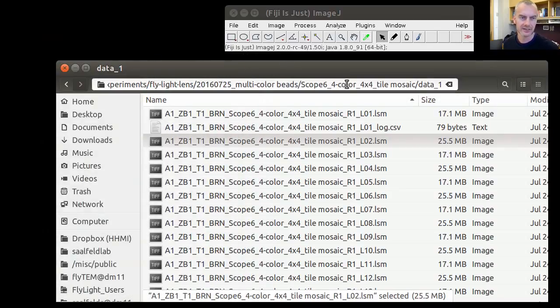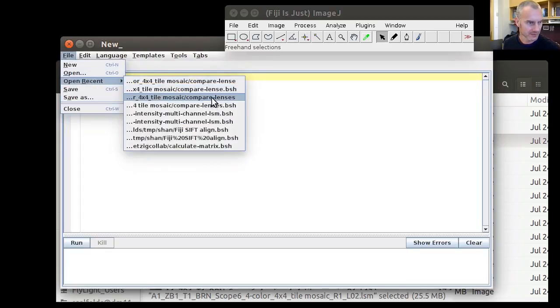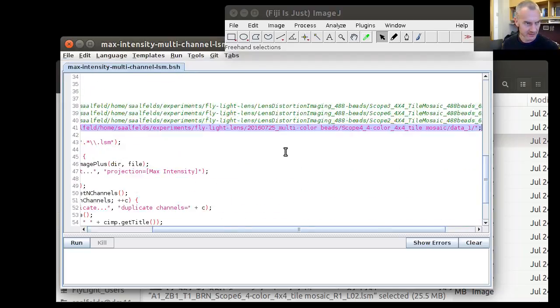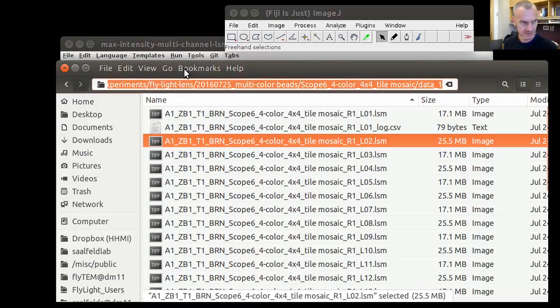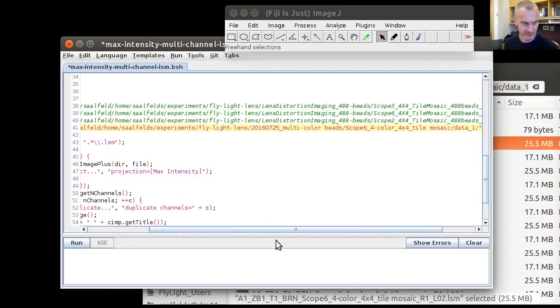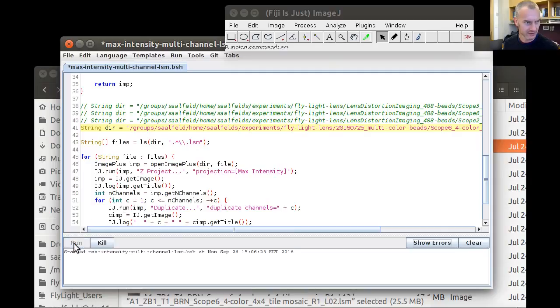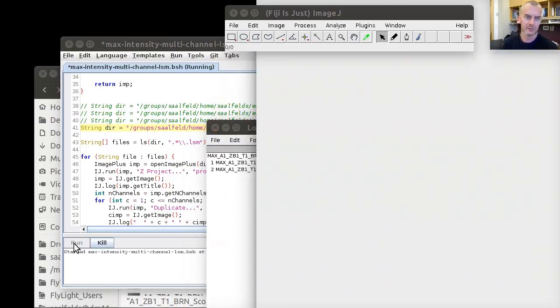So in order to project these individual channels down, we open a script that I wrote for this purpose in Fiji's script editor. That's this, where you find it, the max intensity multi-channel LSM script. And in here, we'll have to change the directory that we're working in. We can copy that from the file browser. Put it in here. Don't forget the trailing slash, because otherwise it's going to break. It'll throw a little exception that it can't find particular files. And then we're running this script, and we'll wait until all images are projected. I can fast forward this.